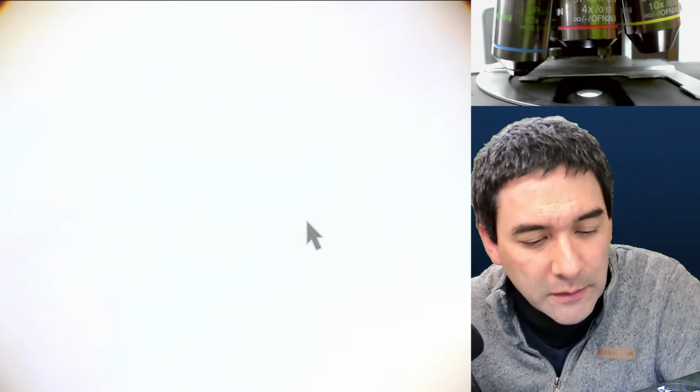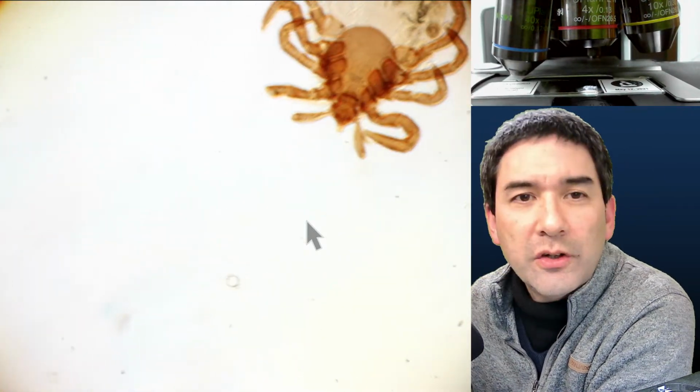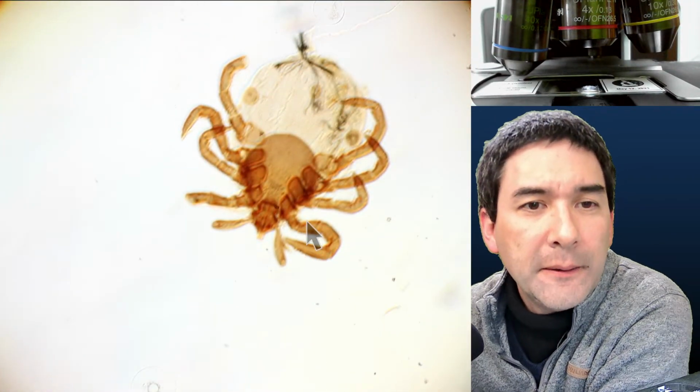I've made videos of this already before. Maybe you already feel a little bit bored about it because I've showed it to you so often. Okay, but now let's have a look at a couple of ticks that I prepared as well. That's one of those ticks that I pulled out of my skin. I have to find it again. I don't even know where it is on the slide now. Just a second. Let me take it out again. It's over here on this side. I was looking on the wrong side. Here it is.